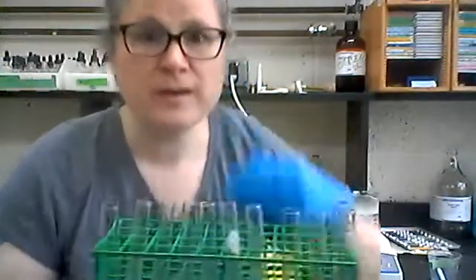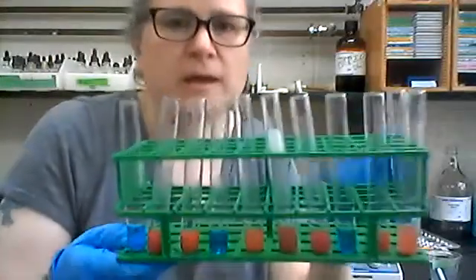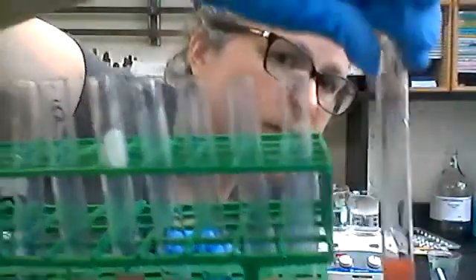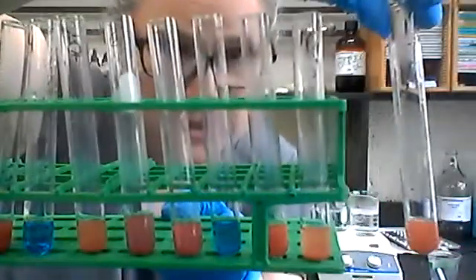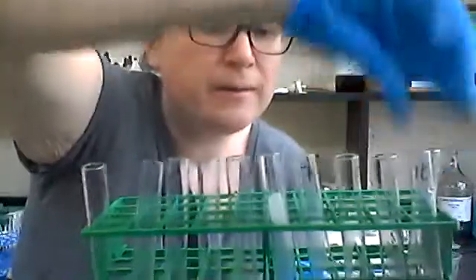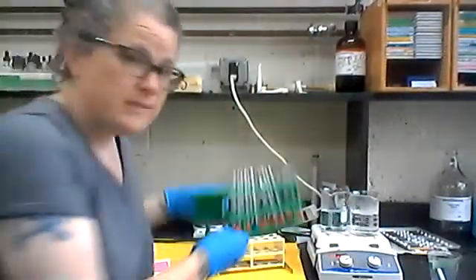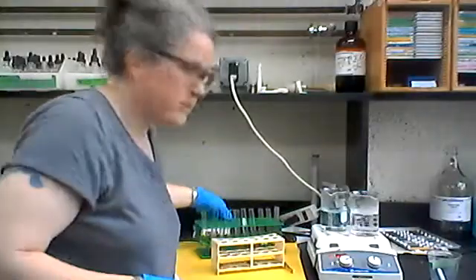Okay, so this has been in the boiling water bath for three minutes, and you can see we've seen a lot of changes with the different carbohydrates. Like I said, I'll post photos of each of those on Canvas and you can use those to fill in your tables and answer the questions in your lab manual.